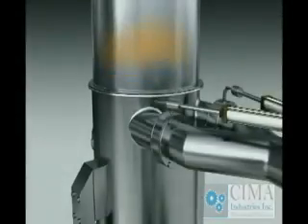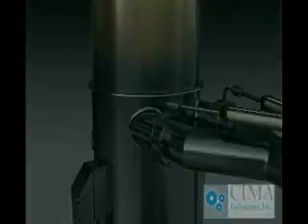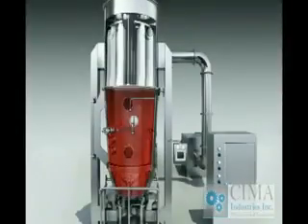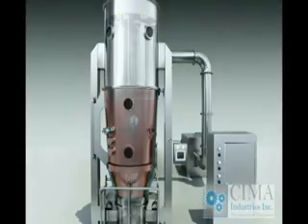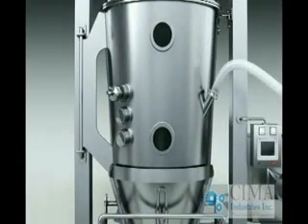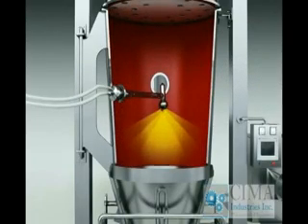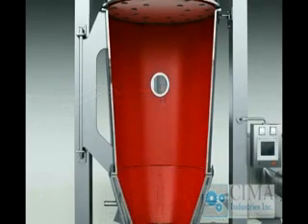1. Please consider the layout of the explosion release ducts for explosion-proof type. 2. WIP system is available on request. 3. Vacuum feeding arrangements are available on request. 4. Integration of top spray granulation, bottom spray coating, also known as Wurster inserts, and tangent spray for pellet making are available on request.